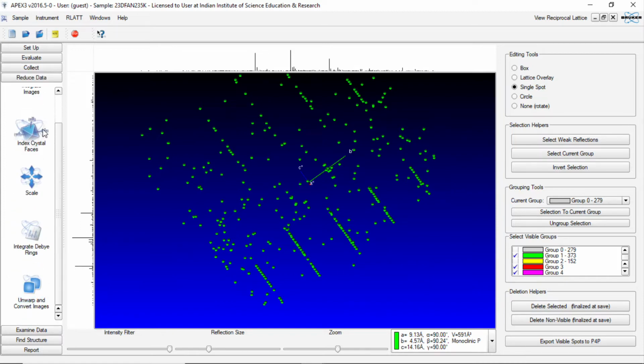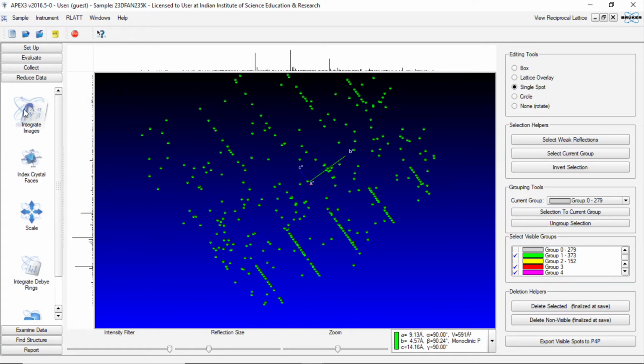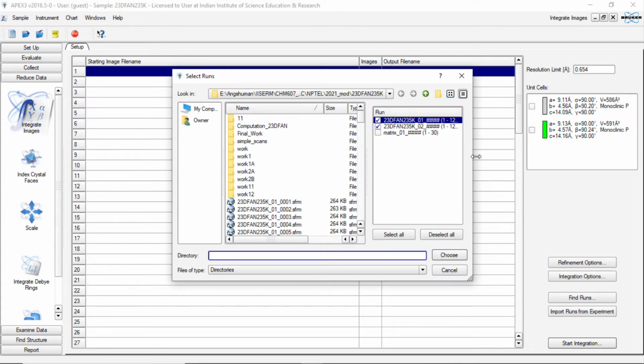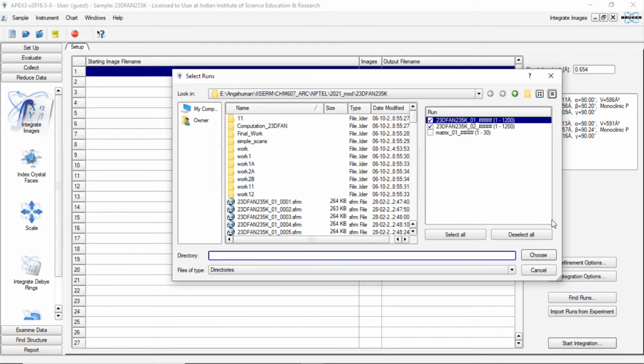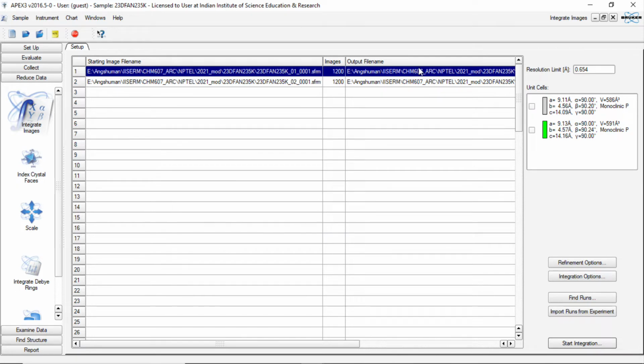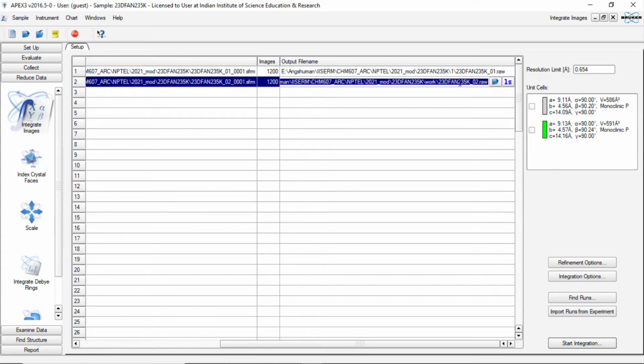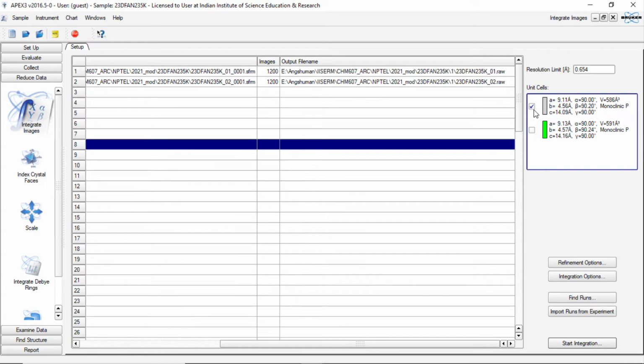So I will now go and try to do the data reduction as usual. But here, what we will do is we will select the runs. We have here two sets of runs. So we will take those two sets and refine them or integrate them in a folder called, instead of work, I will call it as 1. And here also it is 1. That is the first unit cell, that is my gray unit cell. And we will start the integration.